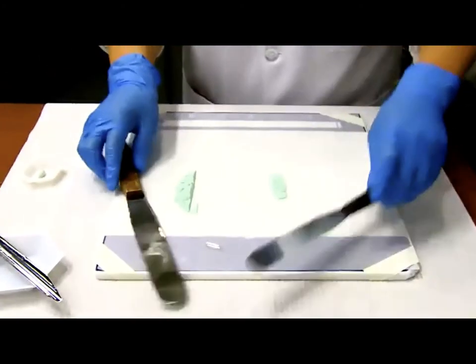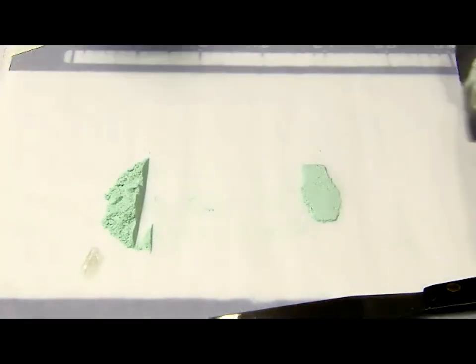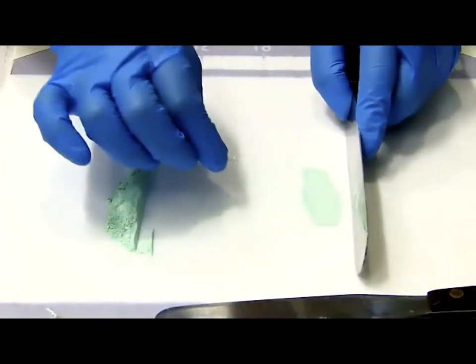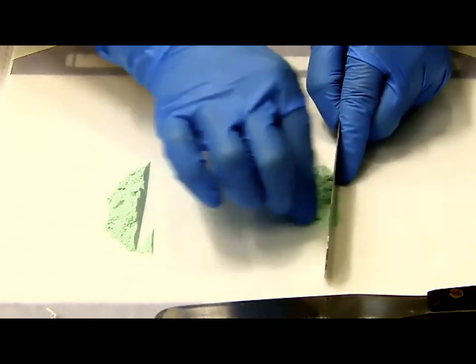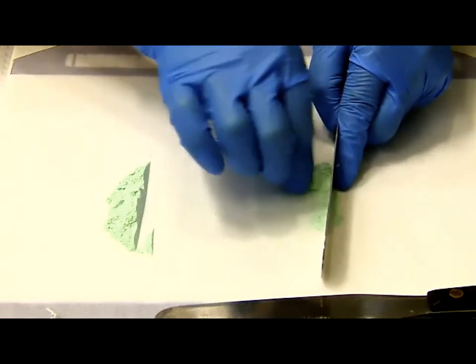All right, here comes the last one. What should I do? Again, using a larger spatula, try to grab your powder together and then make a very tight powder bed. The capsule shell, you open up and place the head somewhere on the bench. Using the body, watch me, you are going to squeeze against the larger spatula. This is the dam method because the larger spatula is serving as a dam, blocking the powder so that you can squeeze against it.